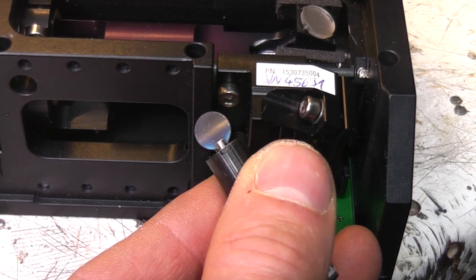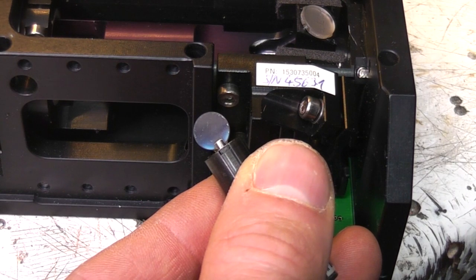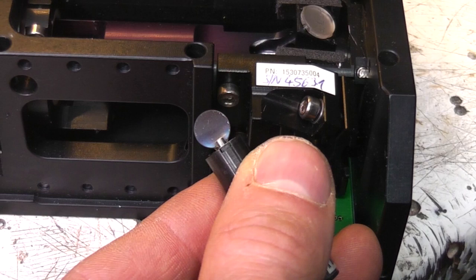The datasheet says it's got a settling time of 300 microseconds, but obviously that needs a proper servo control to achieve. This seems to vibrate. The amplitude dies down quite rapidly above about 200 Hertz.